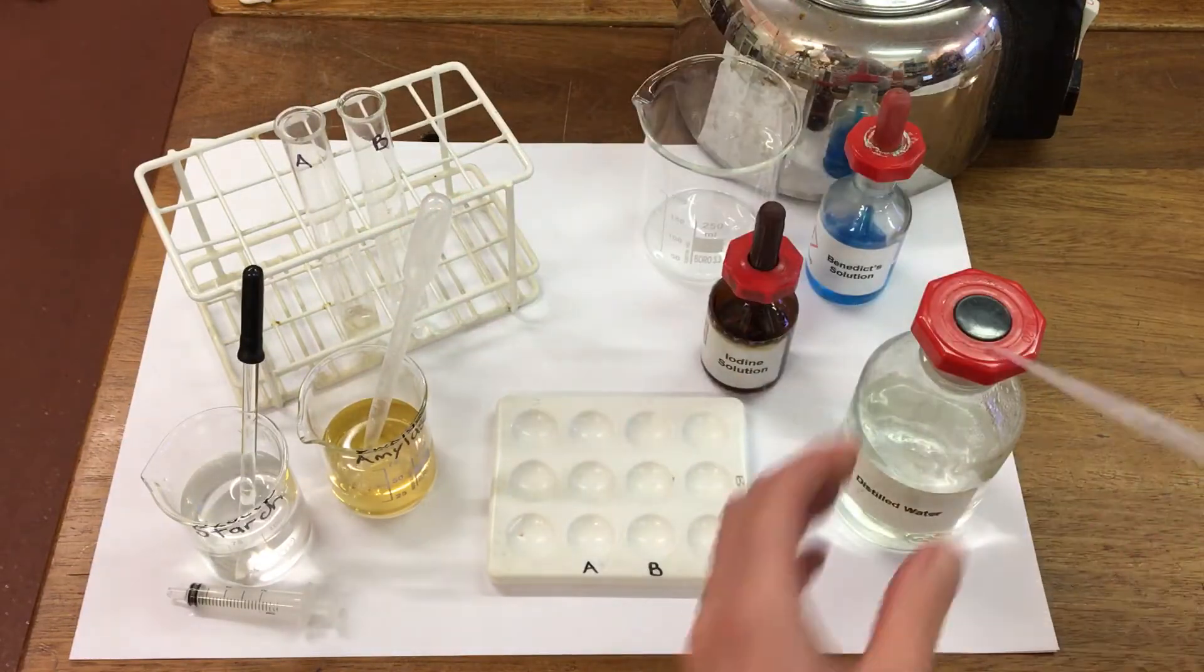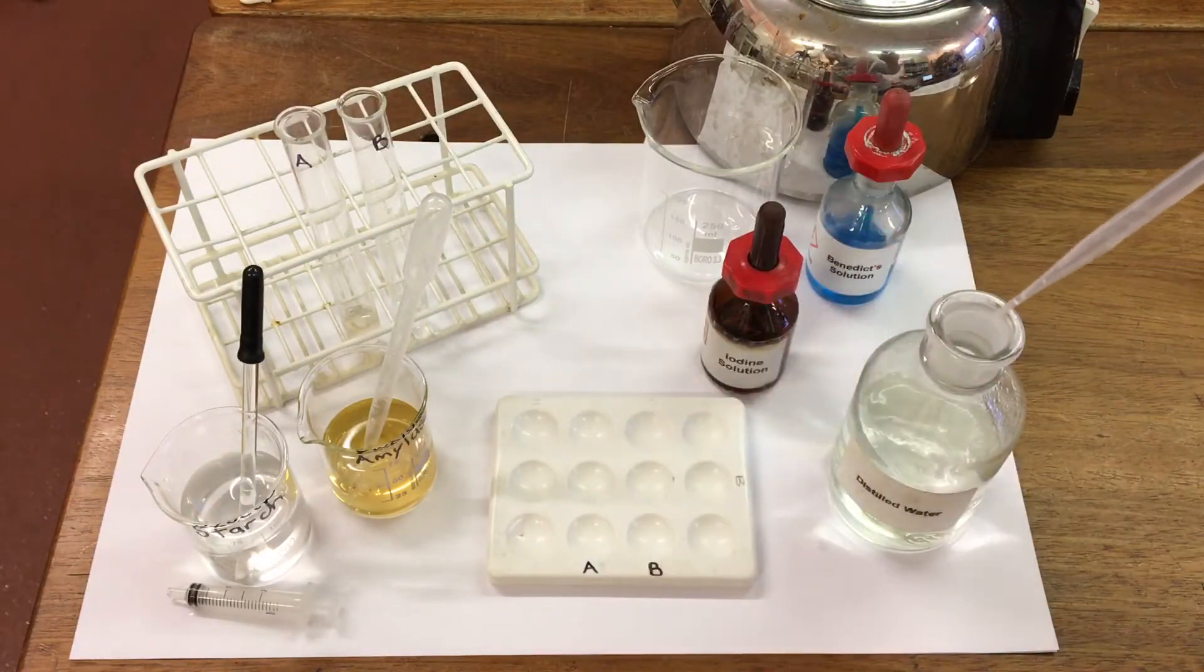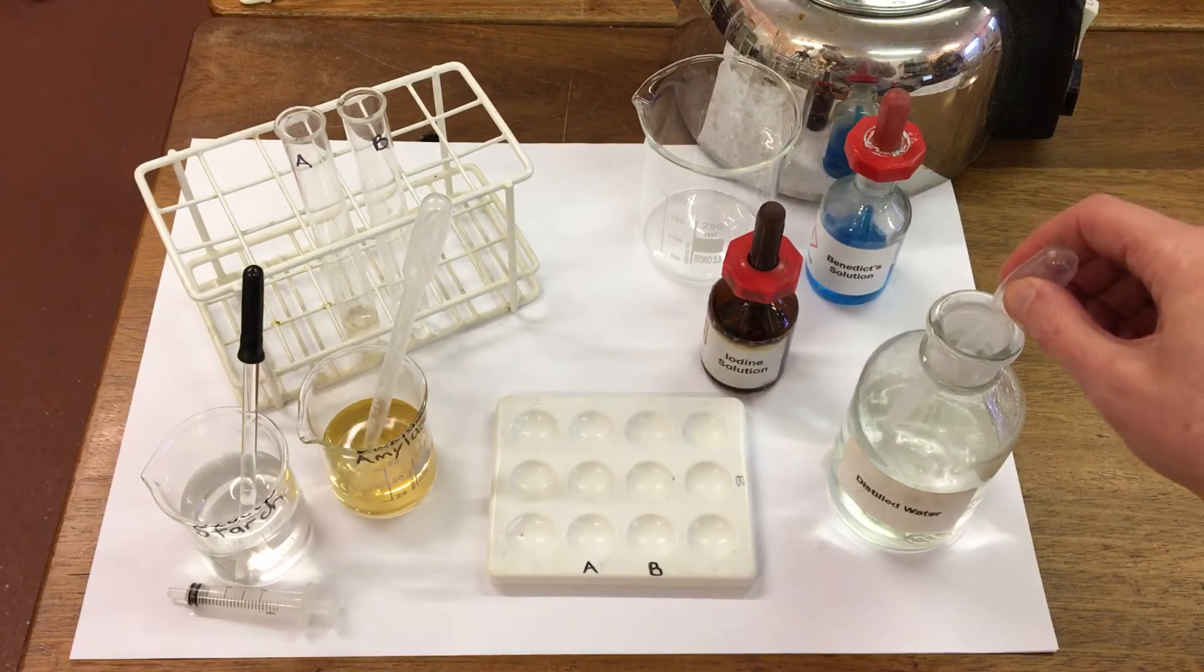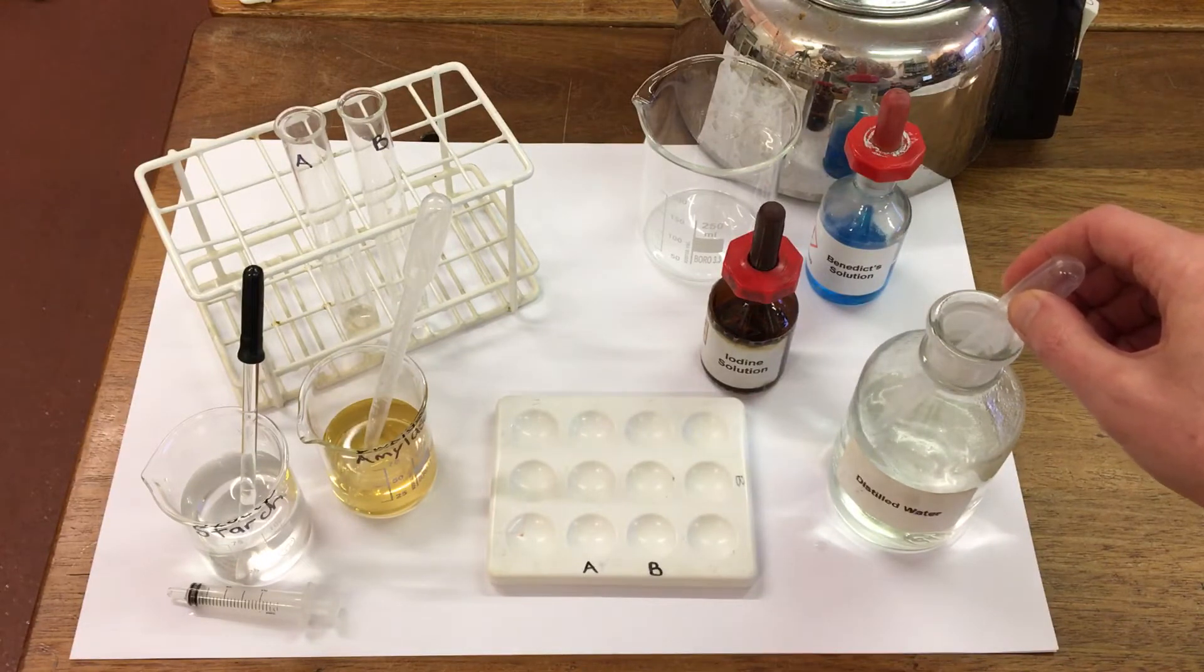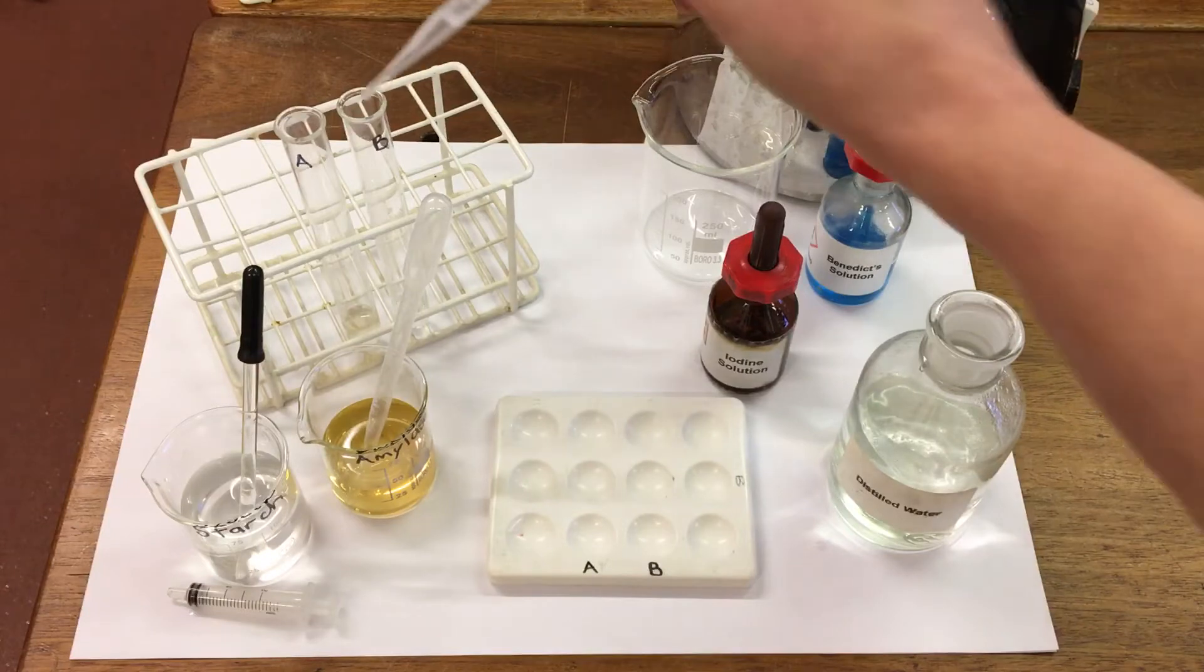And to test tube B, I'm going to add 1 ml of distilled water as a control.